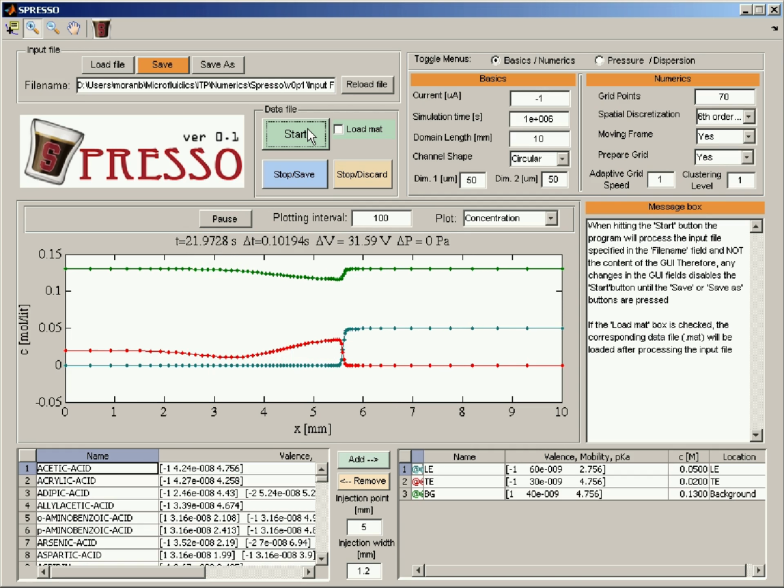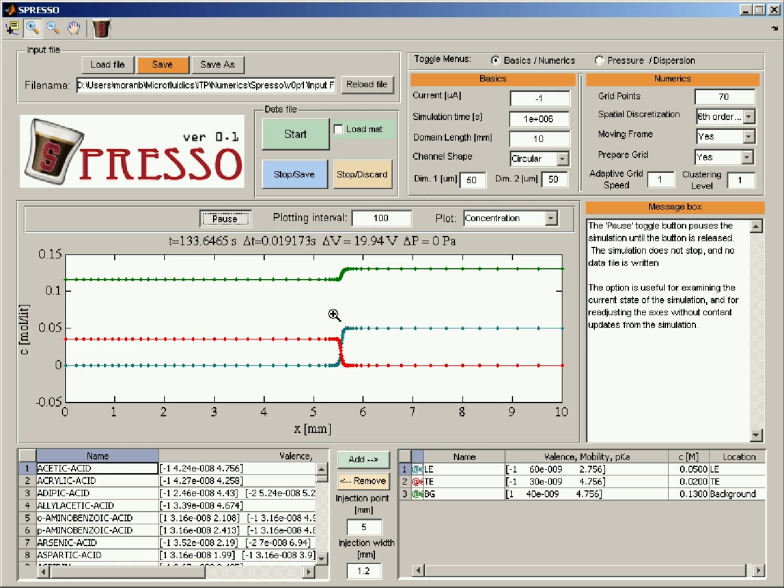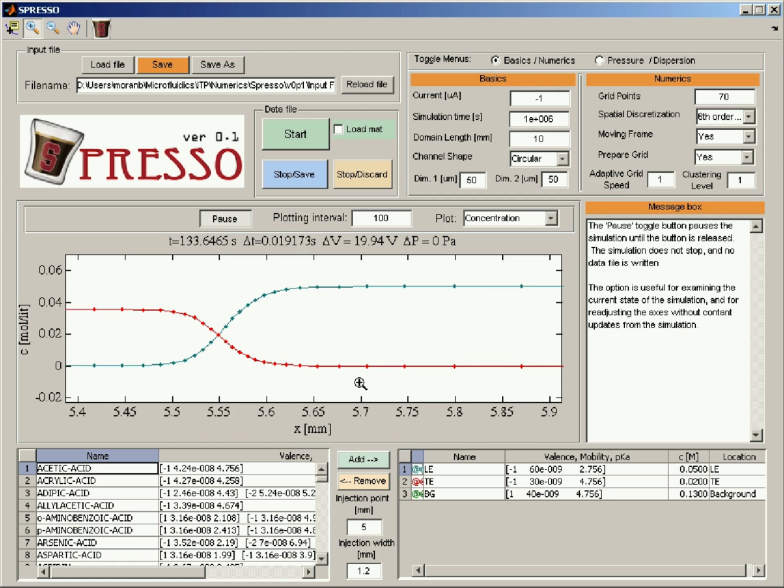But since the interfaces, especially in ITP, are typically much smaller than the size of the channel, we get all the information that we're interested in at the middle of the domain. So this is just a faster way of obtaining steady-state results. Now let's see what happens if we want to increase the current density. So I'll pause this for a second and zoom in on the interface. And you can see that the interface right now, its width is about 0.1 millimeters, so 100 microns.